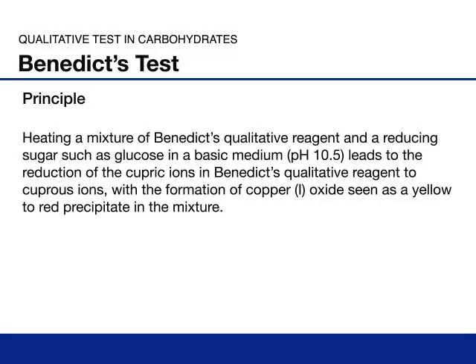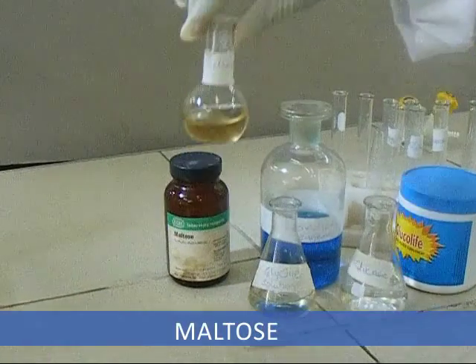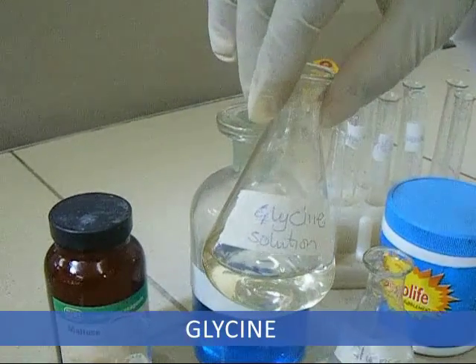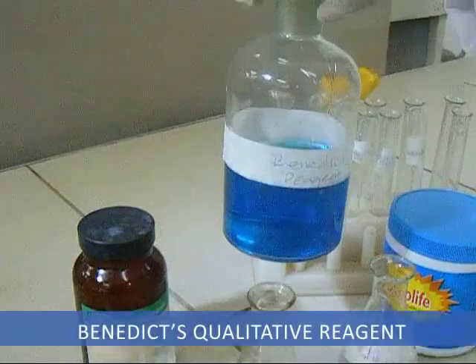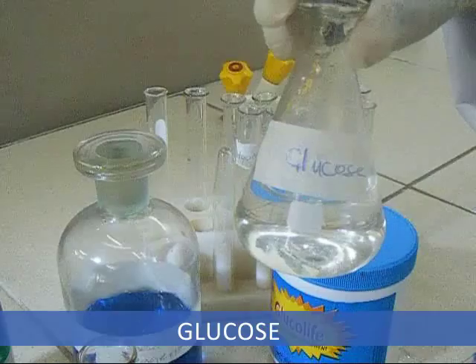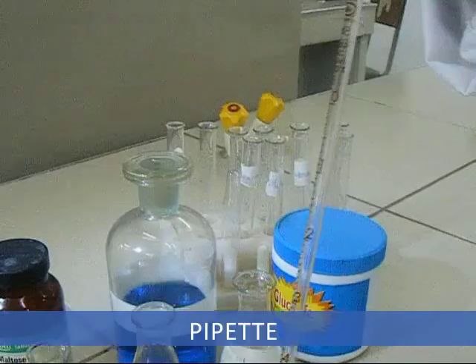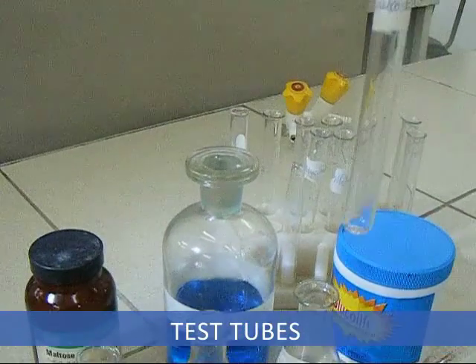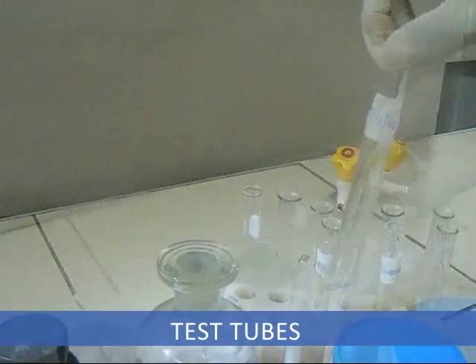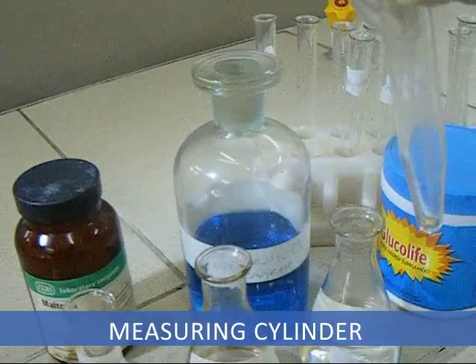The materials used in this test procedure are: Maltose, Glycine, Benedict's qualitative reagent, Glucose. You may also need a pipette, test tubes, and a measuring cylinder.